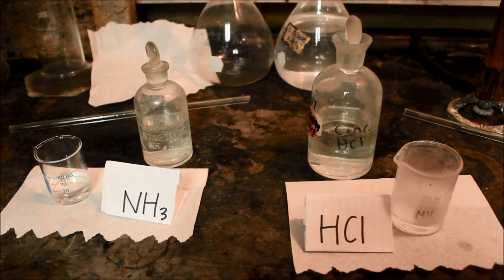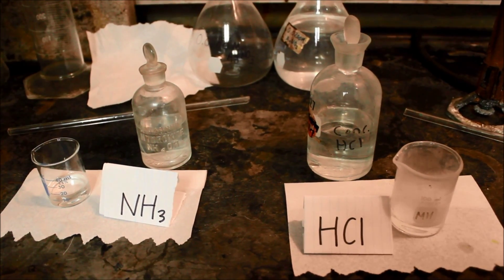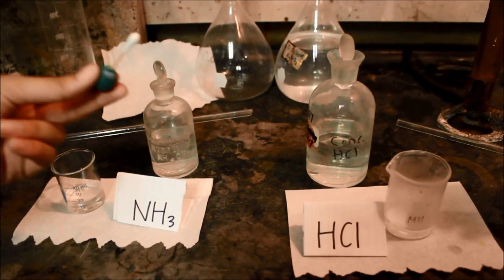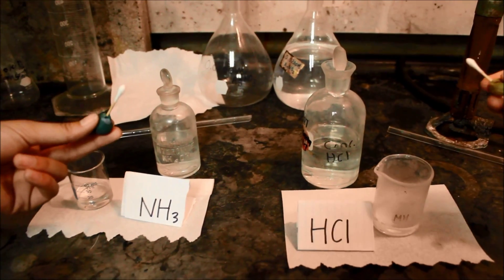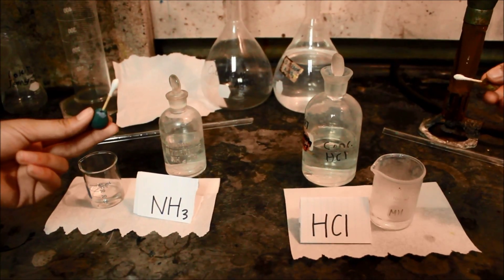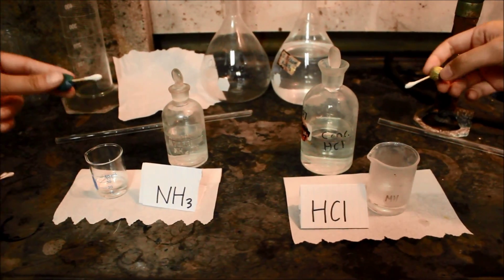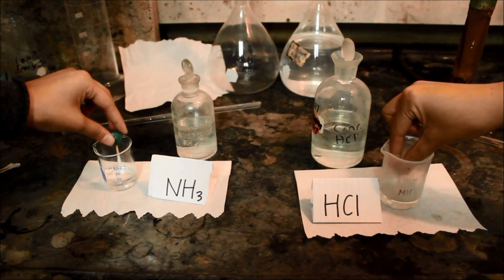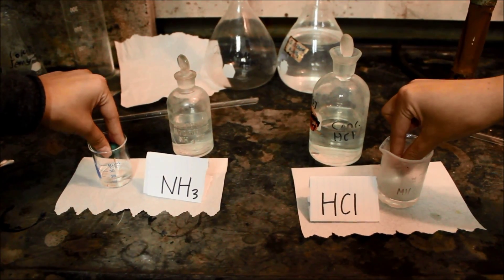We have prepared beakers of NH3 and HCl. We also have q-tips with clay, and we will dip them into the NH3 and HCl.